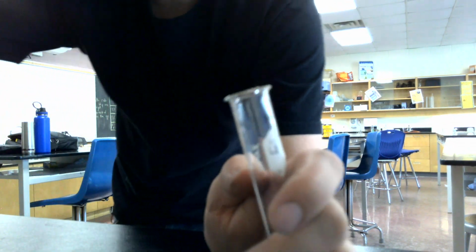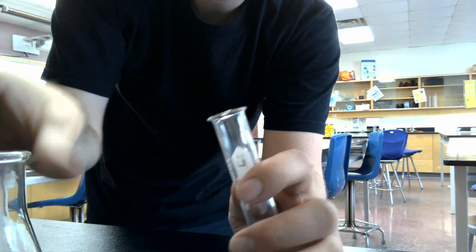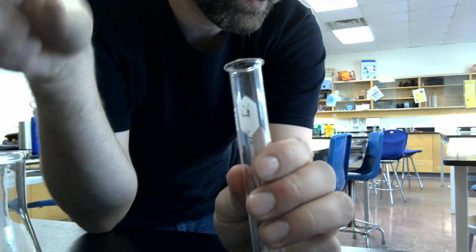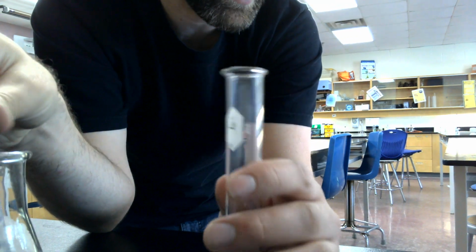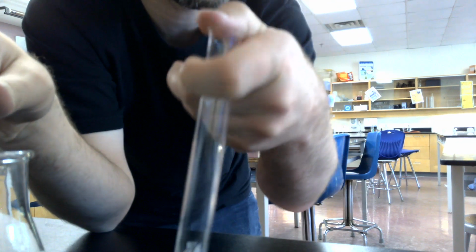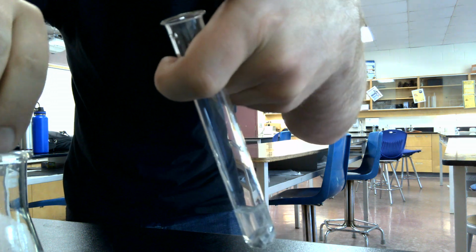And then we are going to get our 1 molar hydrochloric acid. So we got our metal in the test tube. We are going to introduce some hydrochloric acid, and we are going to trap any produced gases the same as before. We are going to now introduce 1 and 2, and sure, that'll be about 3.